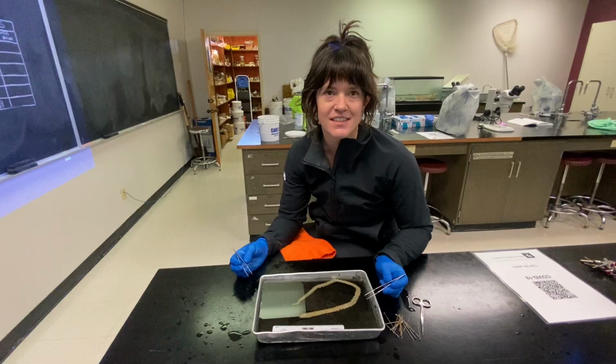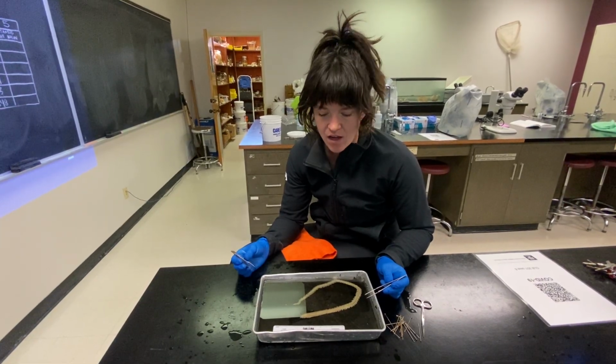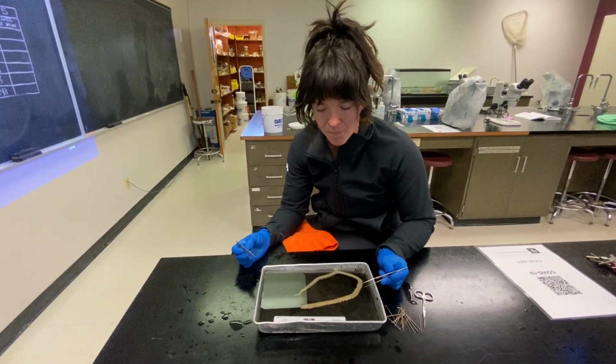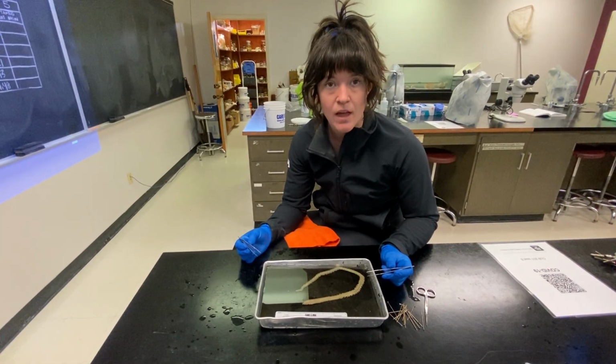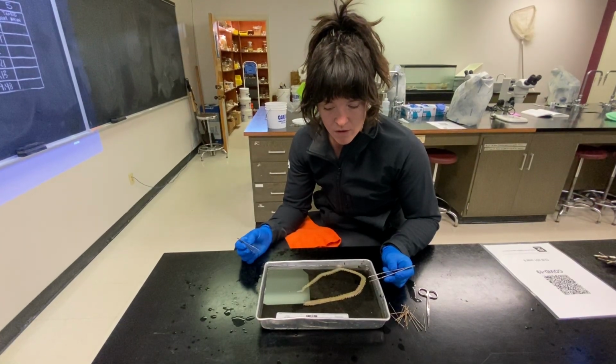I'm one of the TAs here at Texas A&M University for Invertebrate Zoology. I'm going to take us through a dissection of a polychaete worm. The polychaete worm we're going to be dissecting today is commonly called Nereis. It's from the family Nereididae. However, an accepted name is also Alitta virens.